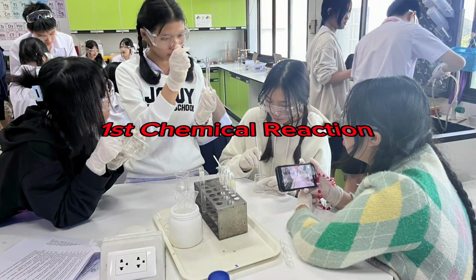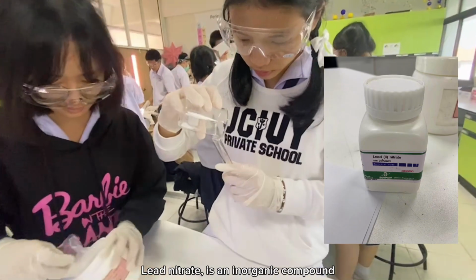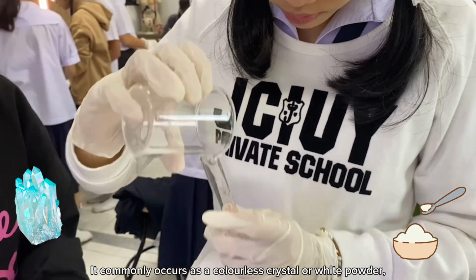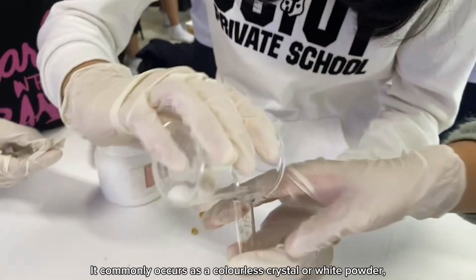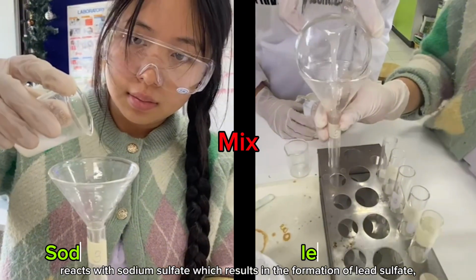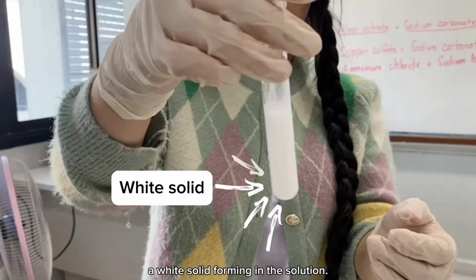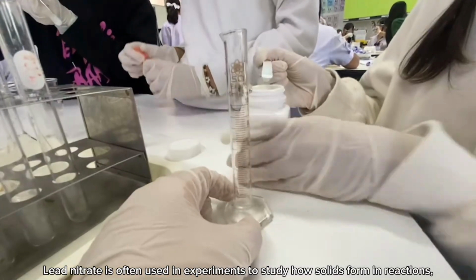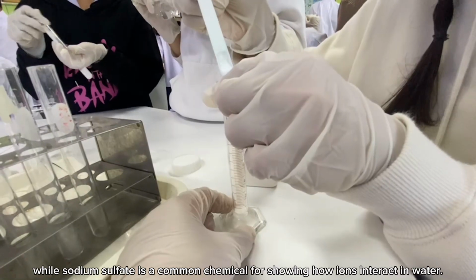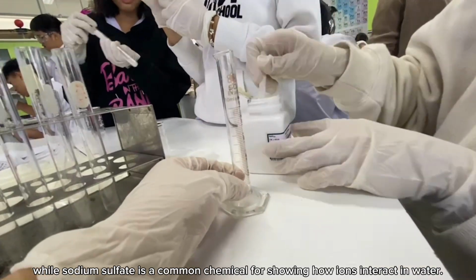Let's go! Lead nitrate and sodium sulfate. Lead nitrate is an inorganic compound. It commonly occurs as a colorless crystal or white powder. It reacts with sodium sulfate, which results in the formation of lead sulfate, a white solid forming in the solution. Lead nitrate is often used in experiments to study how solids form in reactions, while sodium sulfate is a common chemical for showing how ions interact with water.